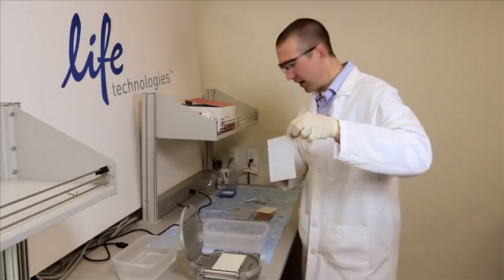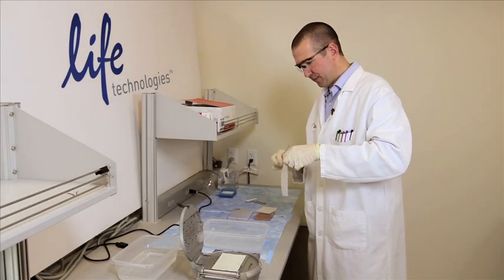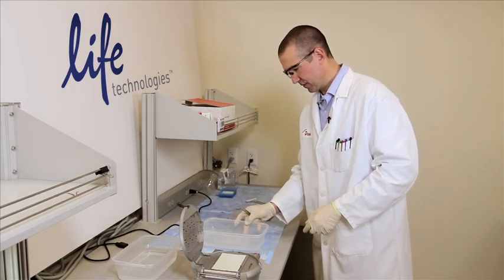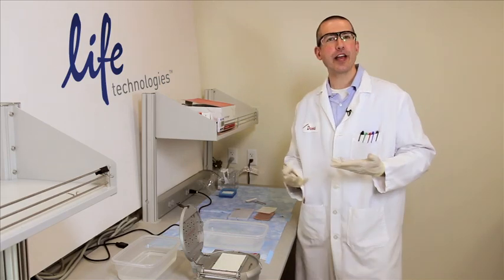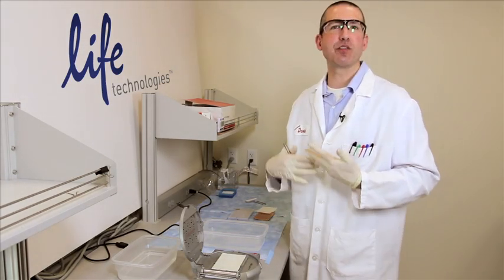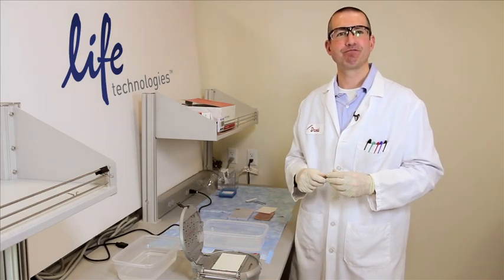So now this blot is ready to put in block followed by primary antibody, wash, secondary antibody, wash, and follow up with detection. And that's it.